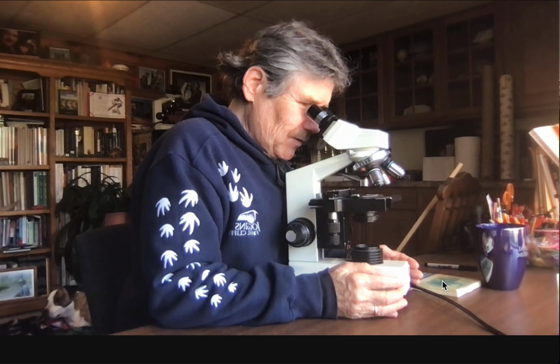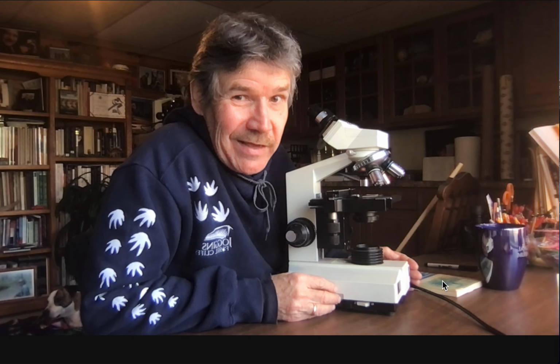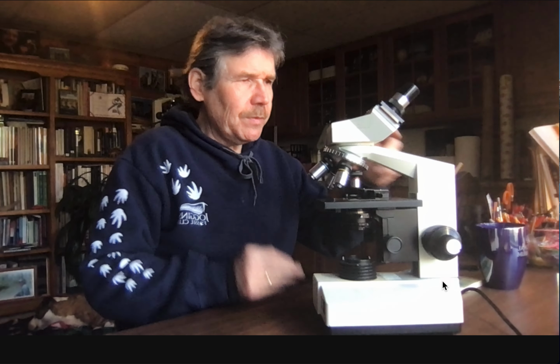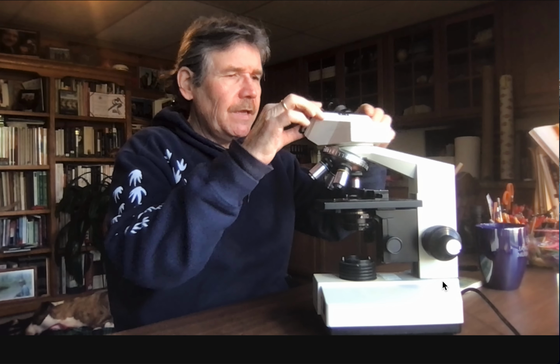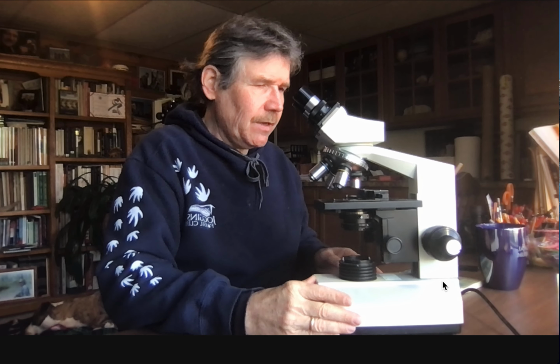So when you lean over the microscope like this, you're kind of hunched over. Don't want to do that for all day or a whole summer. So most of us prefer to use the scope configuration where the ocular lenses right here are pointed out farther away.